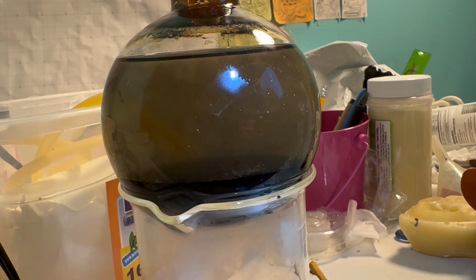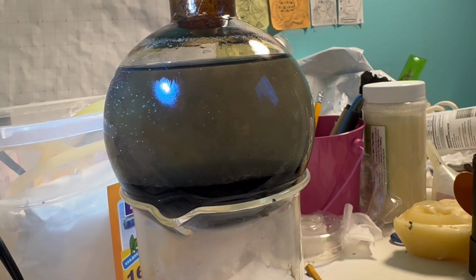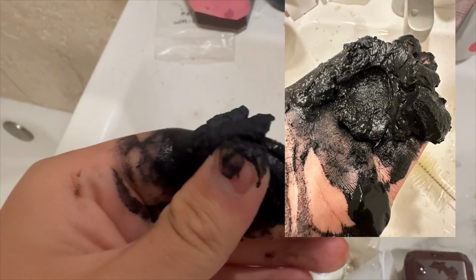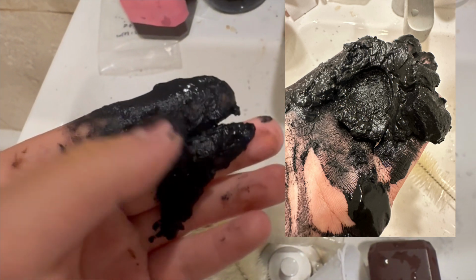As you can see, there is no more permanganate left in the round bottom, and a dark precipitate has fallen out of solution. I then filtered everything, first through coffee filters and then through cotton. I honestly didn't know what the black precipitate was, as it really wasn't manganese dioxide, and that was the only thing it really should have been.